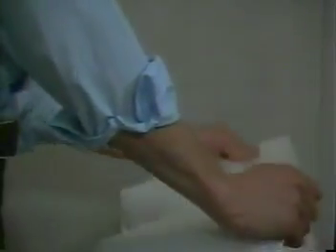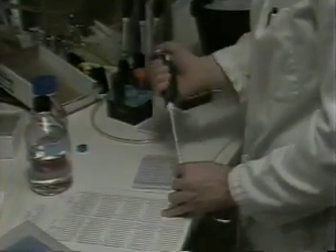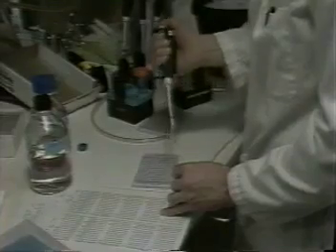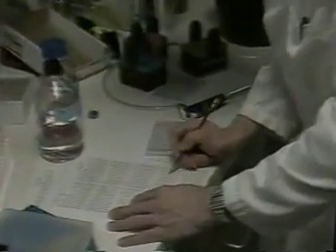When his protocol is complete, Tom picks it up from the printer and then goes into the laboratory to prepare his samples. He begins by pipetting the appropriate cells and reagents into each microtiter plate well. Tom has found that staining in microtiter plates rather than tubes is considerably more convenient and actually improves staining quality, particularly when handling large numbers of samples.